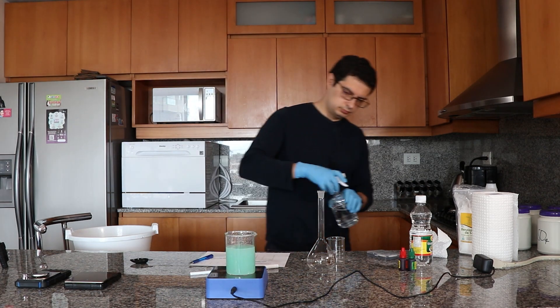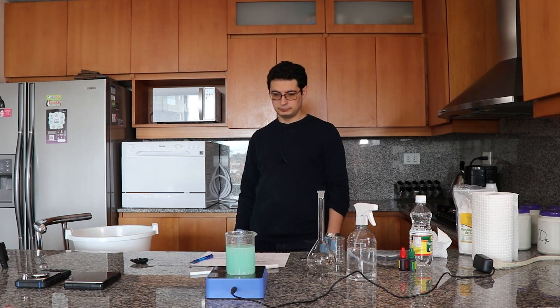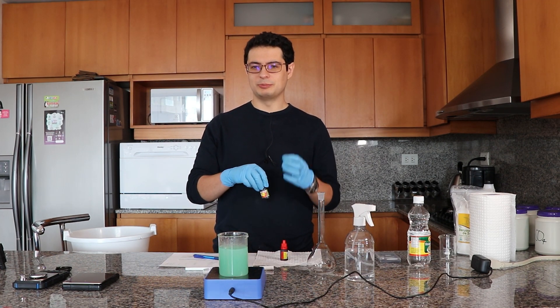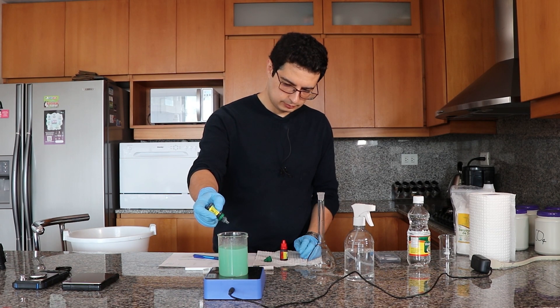I'm adding more distilled water — 200 mL here — to get everything to dissolve, keeping it below the 250 mL total I'll be taking the solution to. As you can see, it never gets completely clear because of the impurities in the sulfates, so it's always a little bit cloudy, but it gets clear enough.